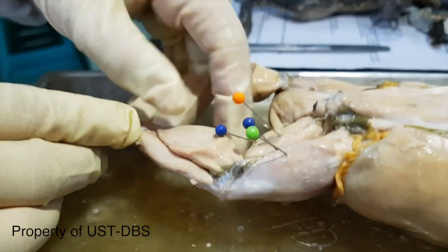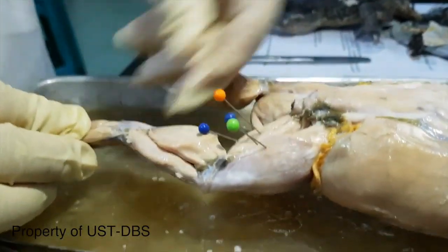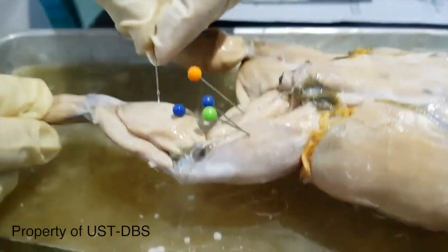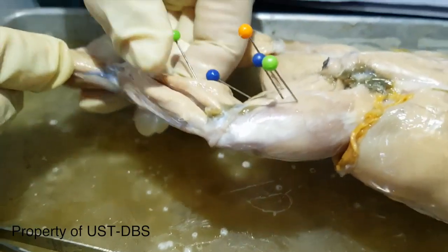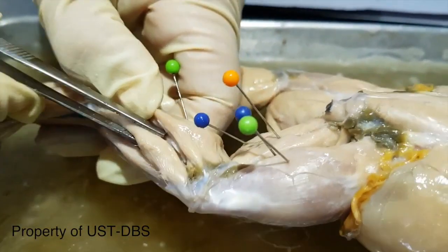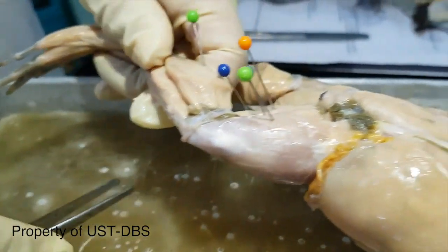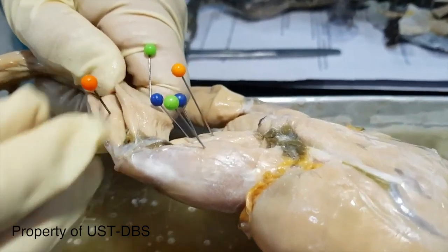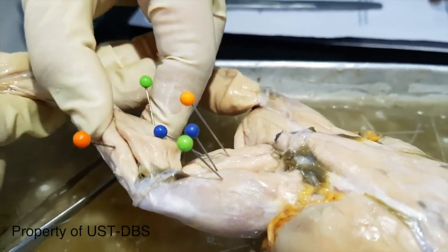Then muscles of the shank. This big muscle, triangular in shape, which all goes towards the tendon of Achilles, is the gastrocnemius, which can also be seen on the ventral side. This flat muscle here is the peroneus. So this is again on the dorsal side. Peroneus can be seen on the dorsal side, and gastrocnemius can also be seen on the ventral side. Okay?